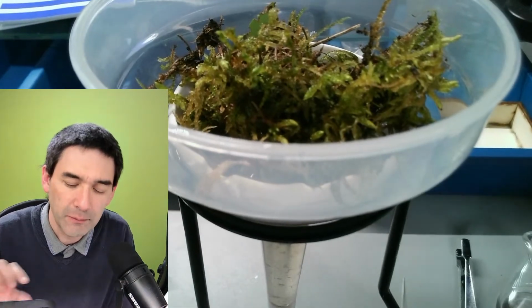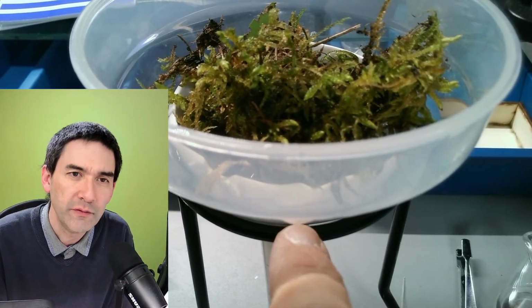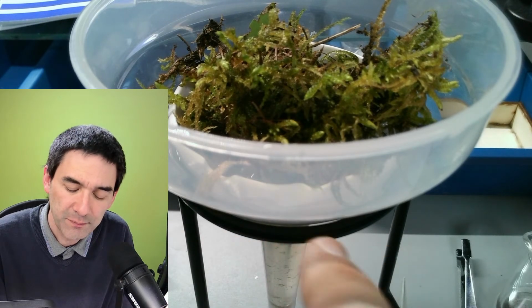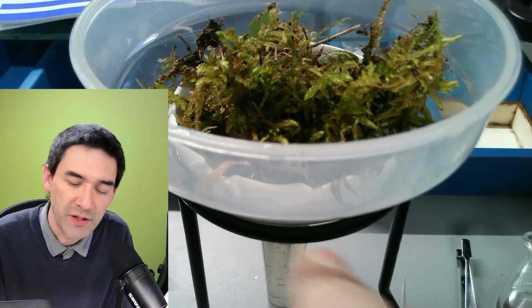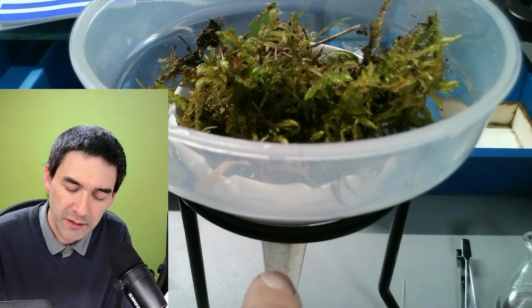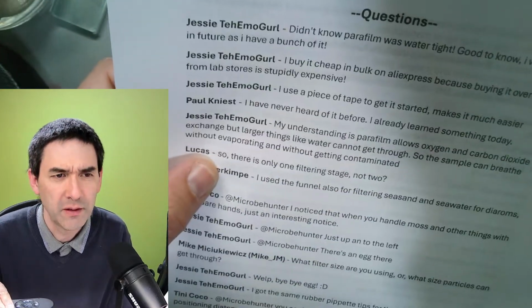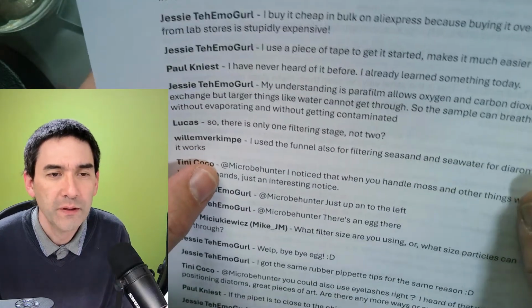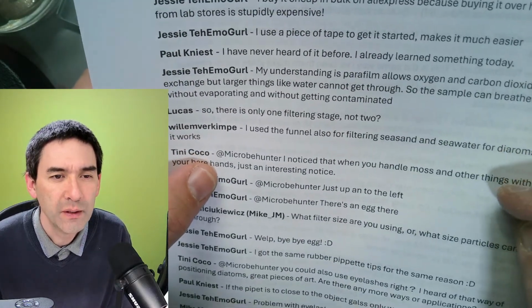Well, actually, for the Baermann funnel, it's not even filtering really. It just basically holds back the larger particles. Otherwise, you've got some leaves of the moss and so on falling down, and that would be a little bit too disturbing. Okay. Filtering sea sand and seawater.